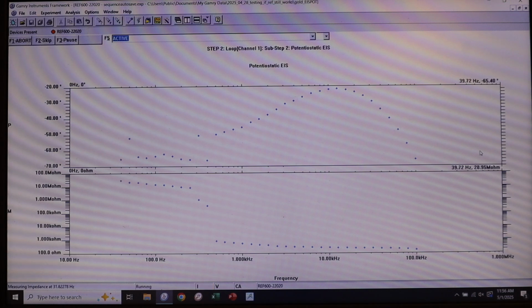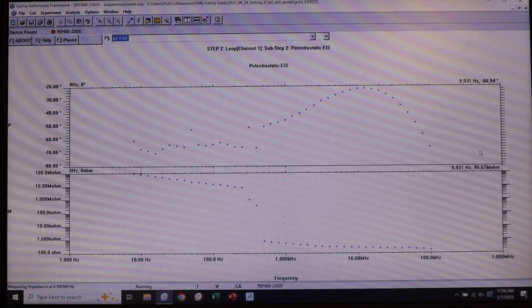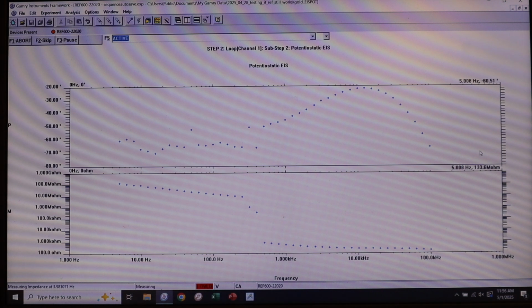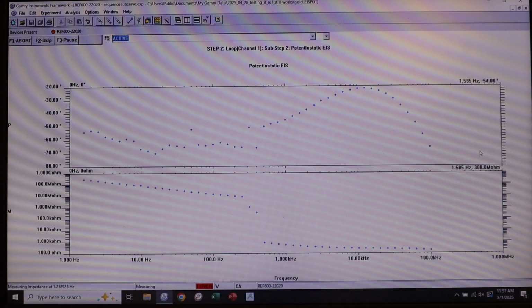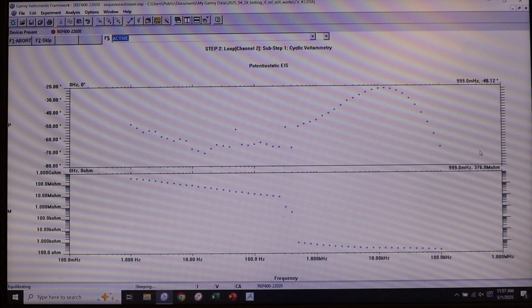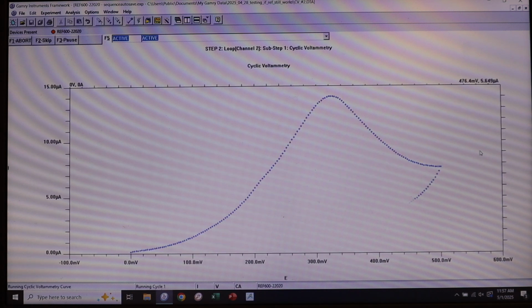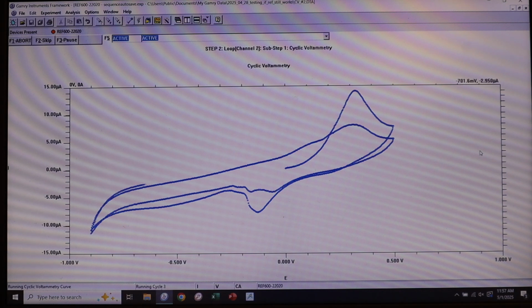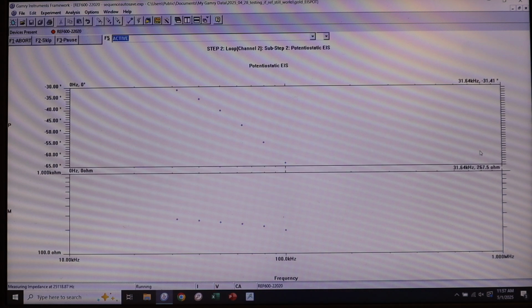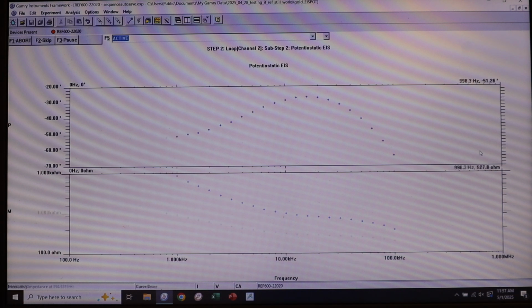So now you can see there's this flashing red light here on the bottom of our screen, and we can see that there's a huge discontinuity where we were looking at really low impedance measurements here, and all of a sudden now it's just terrible measurements. And so this is the first sign that maybe something is wrong. It's not apparent exactly what could be wrong because this cyclic voltammetry, now running on channel 2 here, is working just fine, right? So you could come in and say, okay, my cyclic voltammetry is working fine, but for some reason my impedance spectroscopy is not working fine, or it works fine at the beginning and then it stops working fine. What's wrong, right?